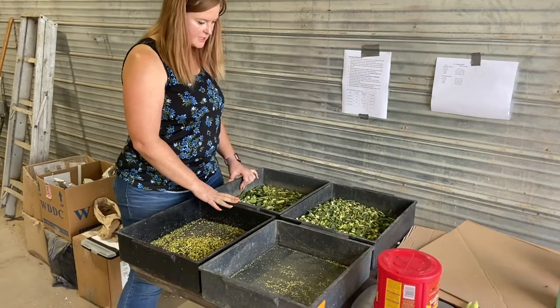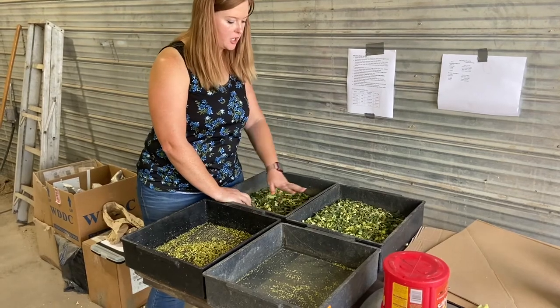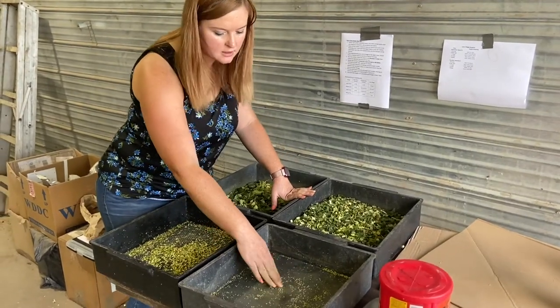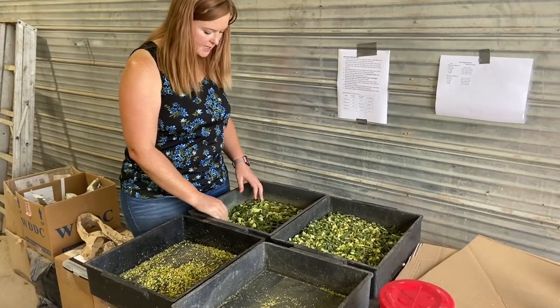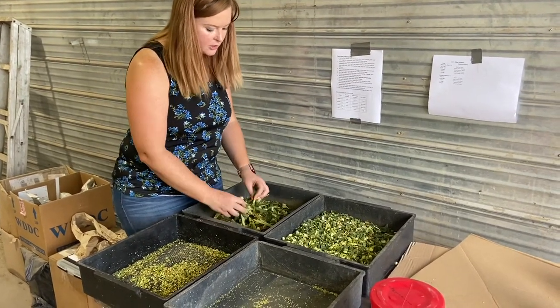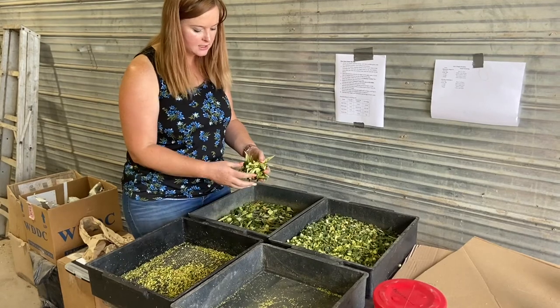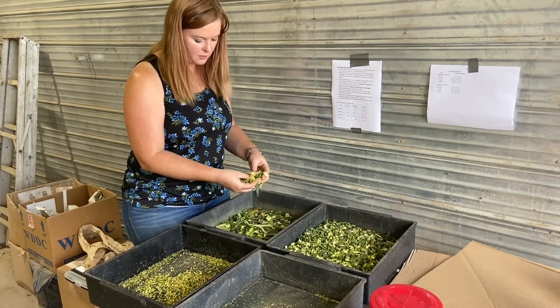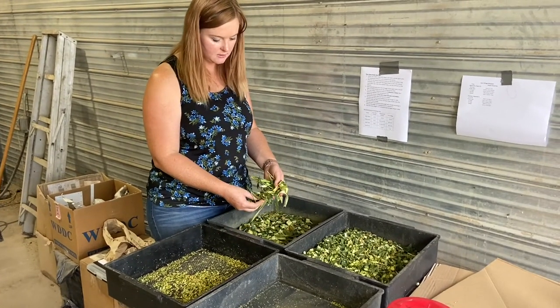We have our four trays after we waited. Tray 1 has our bigger particles. Tray 2 has smaller. Tray 3 has the little stiff particles. Tray 4 is our bottom pan — you only want very small particles on this. On the top one we generally want between 3 and 8%. We don't want the particles too long because the cow can sort through it, eating only the little things, which can give them acidosis. We want that 3 to 8 so they are forced to eat it and sorting is minimized.